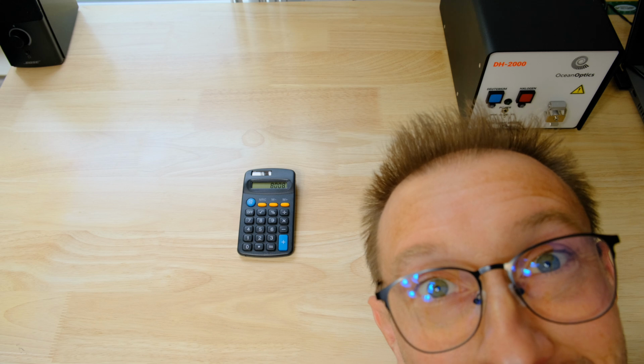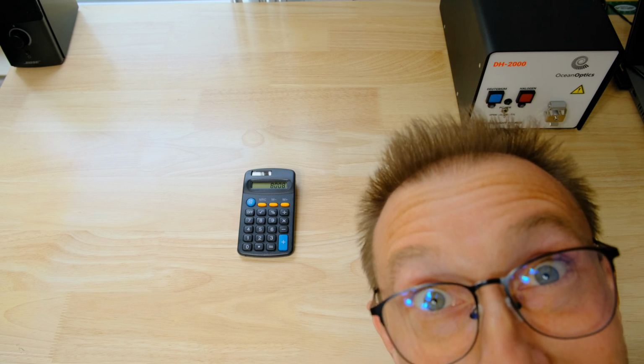Remember doing this in school? Solar cells have come a little bit further since then. Let's take a look.